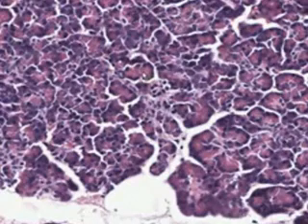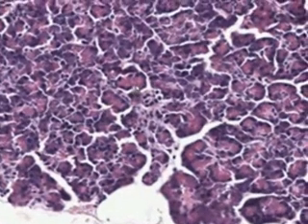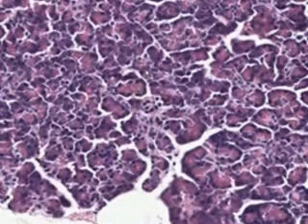These granules in the cytoplasm, like here, and all throughout here, and perhaps the majority of this cross-section, are zymogen granules secreted by acinar cells. Sometimes you have cells which look like fried eggs, like here, and they have no granules. These are centroacinar cells, and they are the very beginning of the duct system.